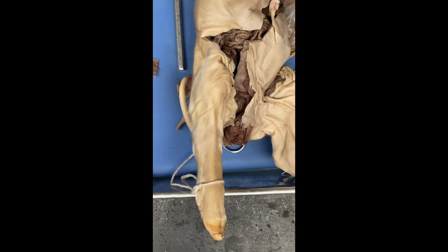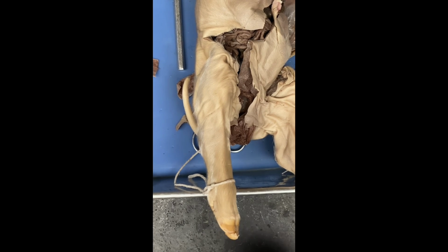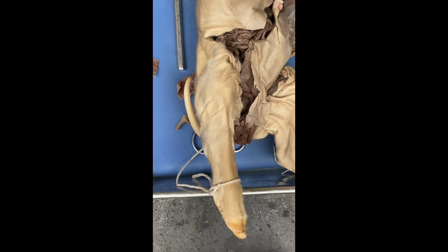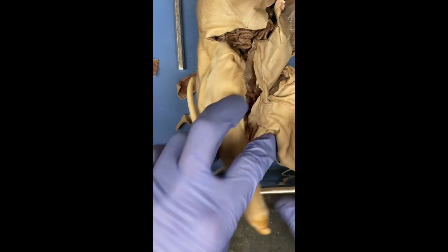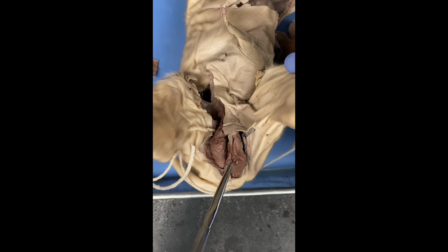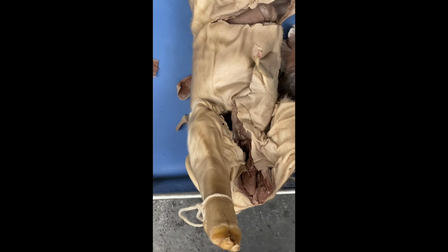All right, we have moved on to the last part of this dissection, which is going to be the urogenital system, but specifically for males. So, just two things. We have the testes and the epididymis. Testes. There's going to be two of them. We've got one here, and we got one here. So those are the two. The purpose of the testes is that they produce sperm.